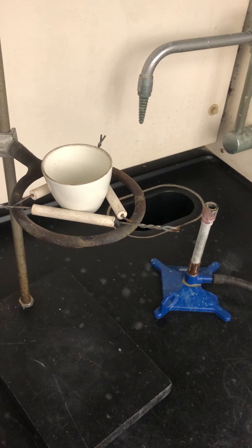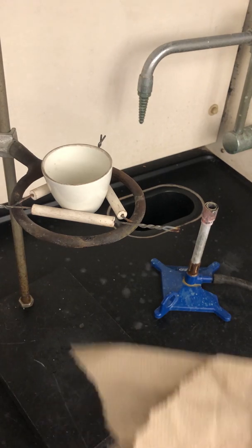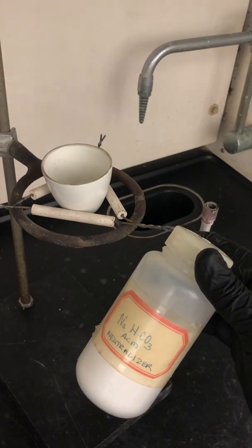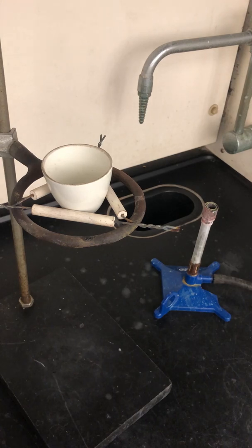At the end of the procedure, if you had any splattering on your bench surface during heating, don't just wipe it with a paper towel — some of that could be concentrated sulfuric acid. Let your instructor know, and we'll pour sodium bicarbonate — essentially baking soda — on it to neutralize it before wiping it clean. You'll also need to dispose of waste and clean the crucible according to the instructions in your lab manual.